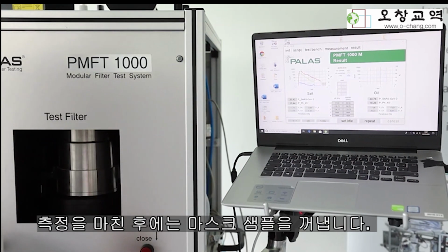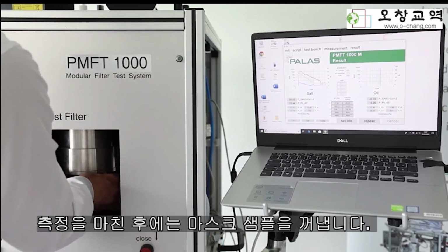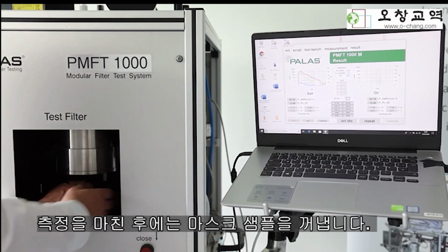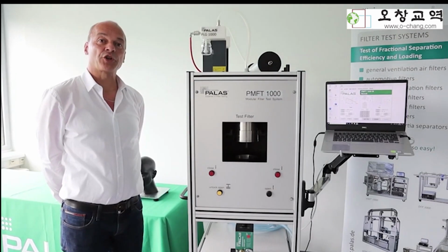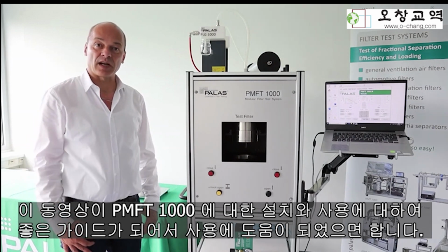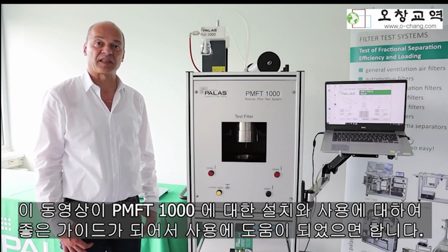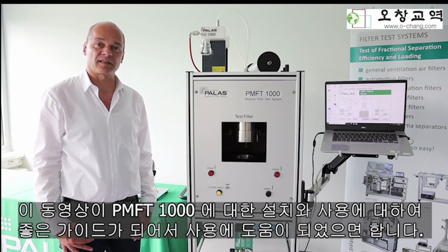Afterwards, you may remove the mask from the test bench and start the next test. We are sure with the PMFT 1000 you get good and quick testing according to the several standards done. I hope this instruction video will help you to guide through installation and operation of the test rig and help you to do the first steps with the operation and the test of the first masks.